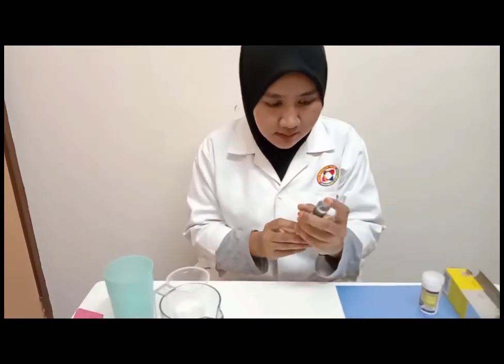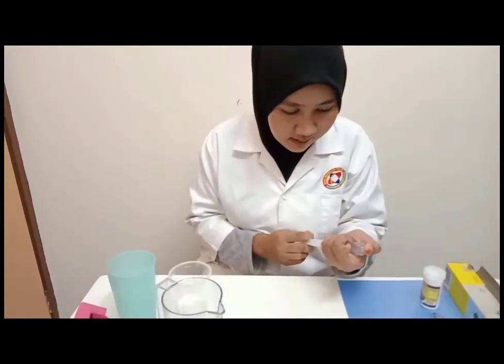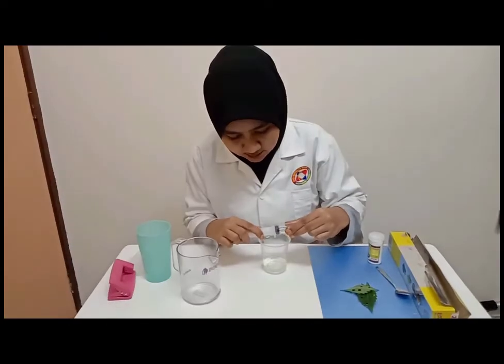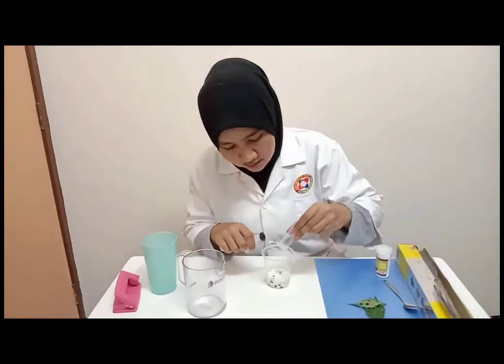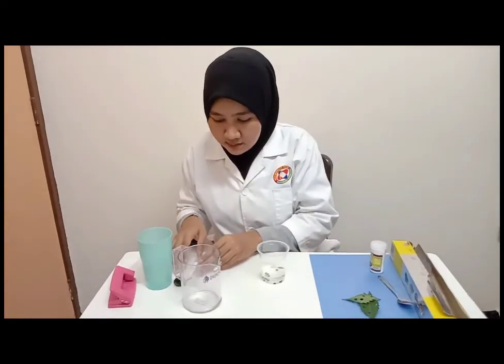And then, the tip of the syringe is plugged lightly with our finger and the plunger is gently pulled, creating a slight vacuum. The vacuum is held for a few seconds and then the plunger is released, letting it go back. Then, repeat all the previous steps until all the leaf discs have sunk to the bottom of the solution. When all the leaf discs have settled to the bottom of the solution, carefully remove the plunger and pour the discs and solution into the cup. They should settle to the bottom of the cup.